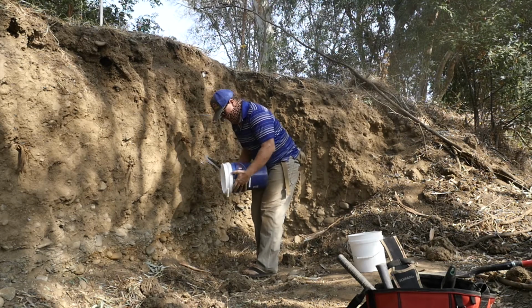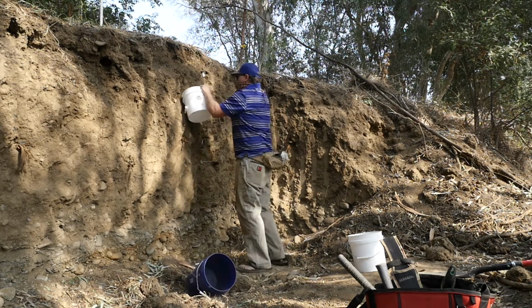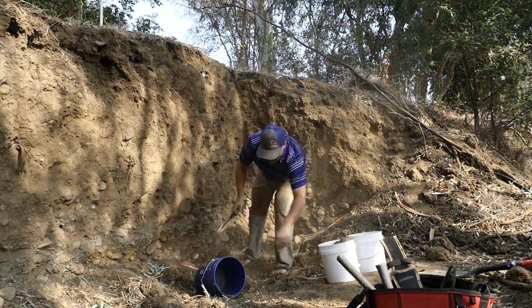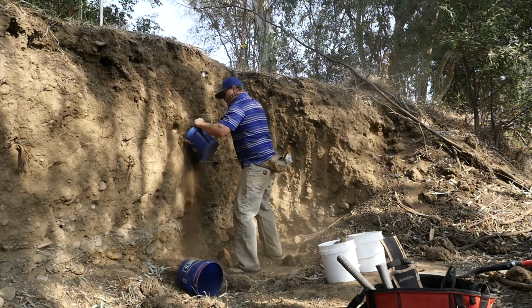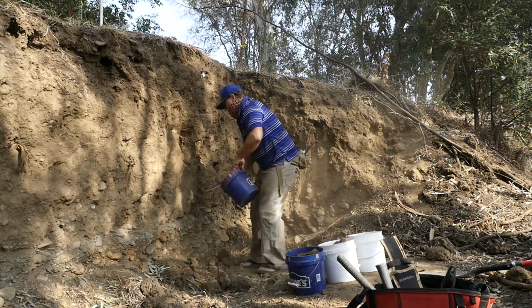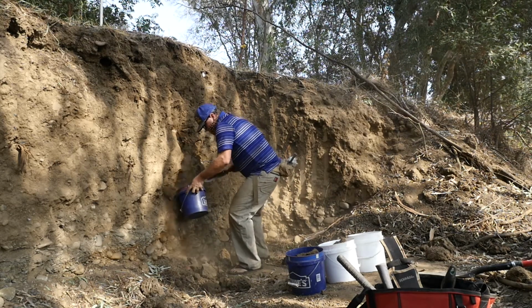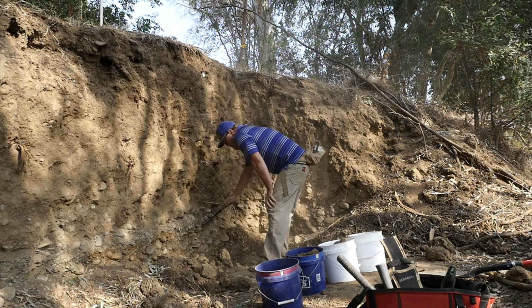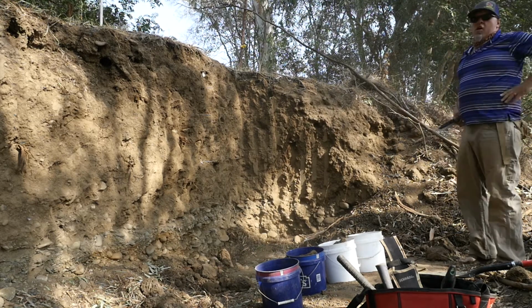Remember, have buckets ready. Oh, I need to work for the rocks. It's going to look like me struggling.